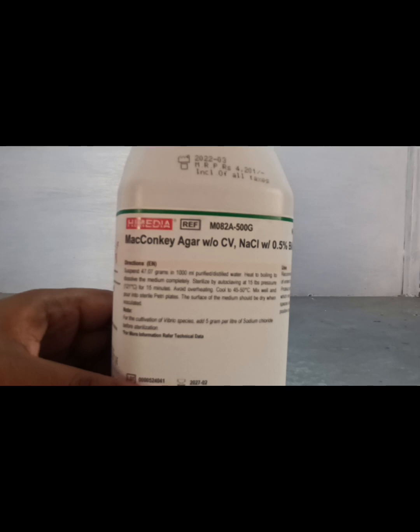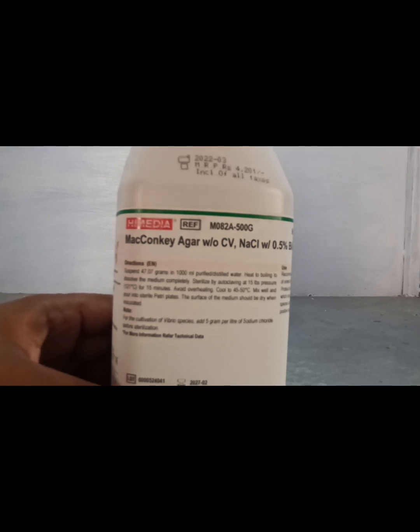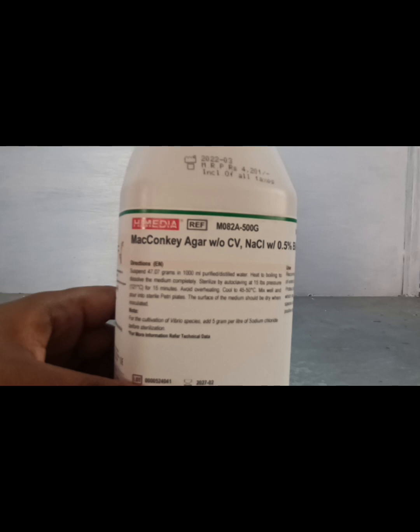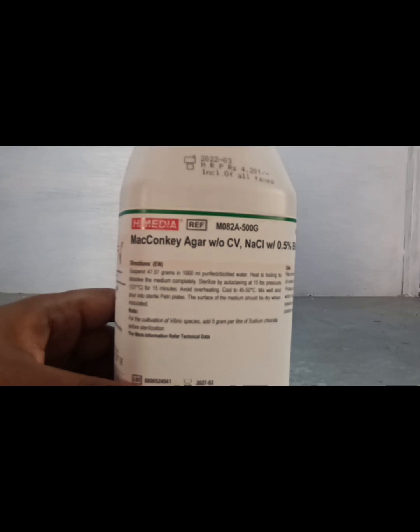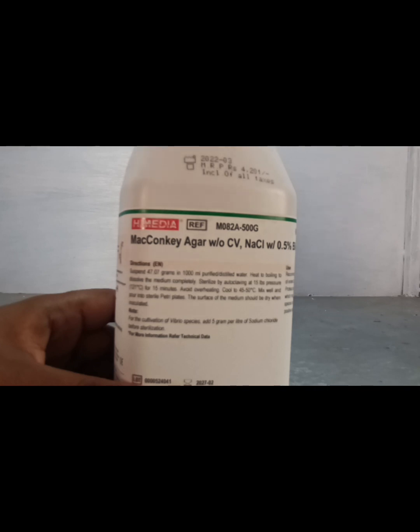Before measuring the MacConkey agar powder, we have to be very clear about how much MacConkey powder we need to dissolve. As per the instructions, 47.07 g is needed for 1000 ml of purified distilled water. Heat to boiling to dissolve the medium completely, then sterilize by autoclaving at 15 PSI pressure, 121 degrees centigrade for 15 minutes. Avoid overheating.